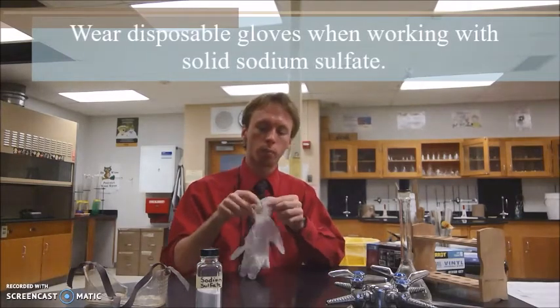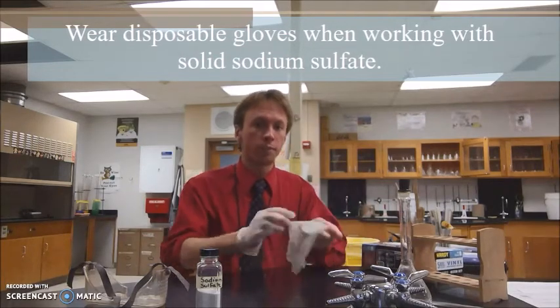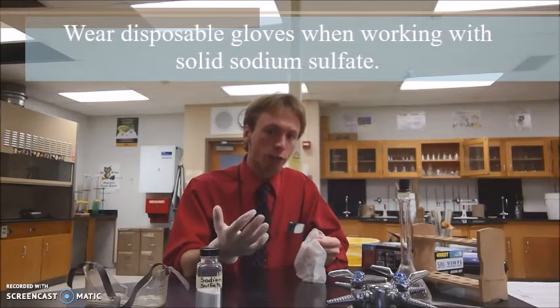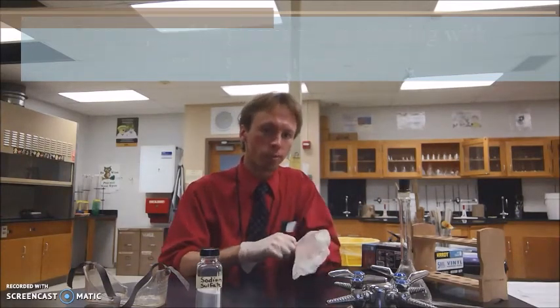For this lab, the chemicals you'll be working with are a white powder known as sodium sulfate. Sodium sulfate looks a lot like common table salt or sodium chloride. However, there is a skin hazard associated with it, and you'll see that in your SDS for sodium sulfate. So what you're going to do when you're handling sodium sulfate is you're going to put disposable gloves on. You'll see in the SDS for sodium sulfate solution, which is what you're eventually making, that it becomes non-hazardous when it's dissolved in water. So just the solid powder form is hazardous. But for that brief time that you're going to use the solid powder, you're going to have disposable gloves on.